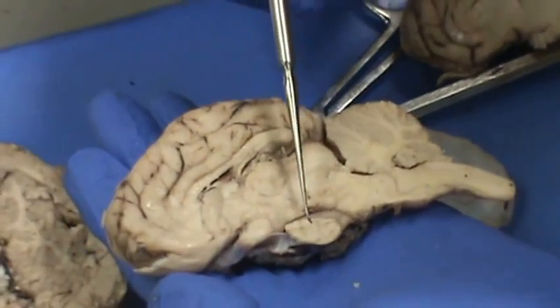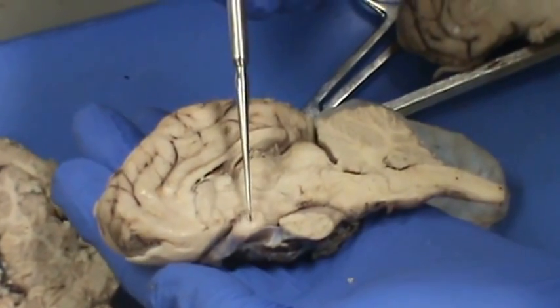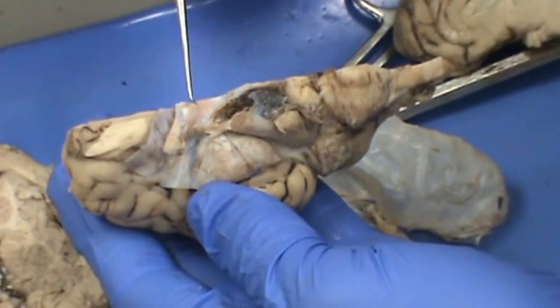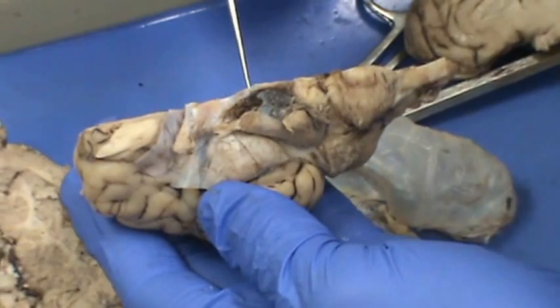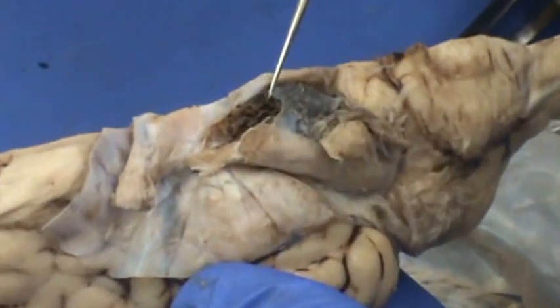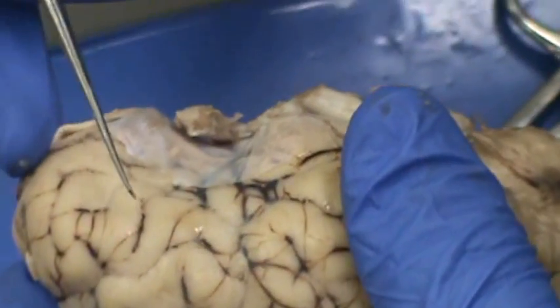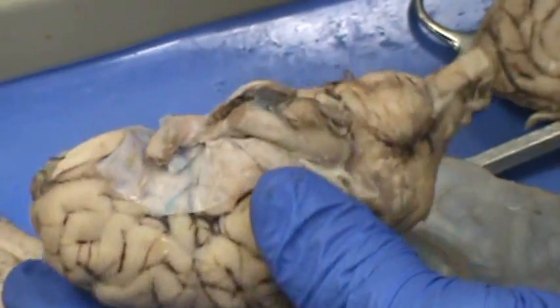This brain has the pituitary gland attached and you can see the optic chiasma clearly. Looking at the underneath: here's your olfactory bulb, optic nerve, optic chiasma, and the optic tract — just a little bit visible. You see these brown strings? That's the arachnoid mater. This tough layer covering the brain is the dura mater, and the layer that you can poke through on your brain is the pia mater.